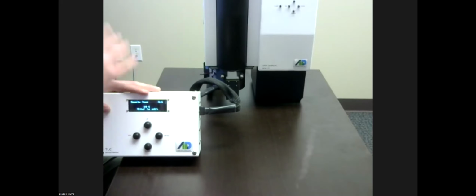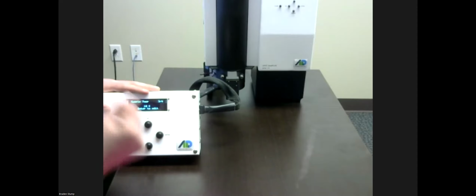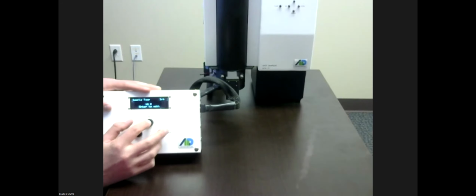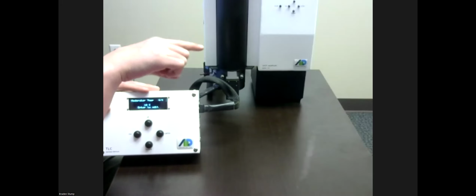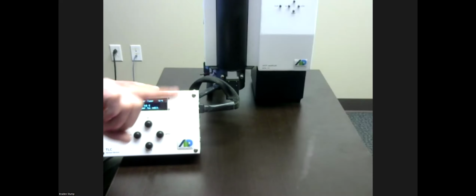In this case, there's not very much aerosol concentration in the air here. And I have low RH in this room, about 17%. So it's easier to have a lower sample temp in order to allow the moderator temperature to adjust around that. And then finally, we have a little bit more of a hidden user setting, which is your starting moderator temperature. This effectively allows you to help with the control from having it bounce around too much or having too much of a poor start.